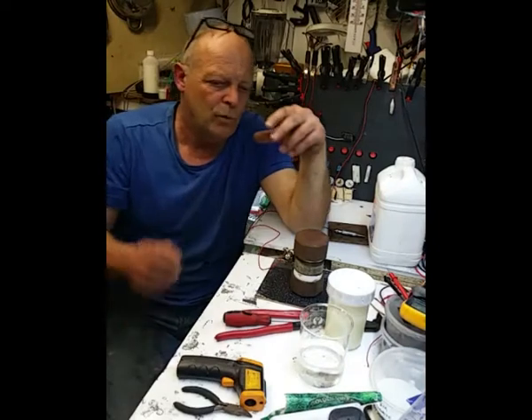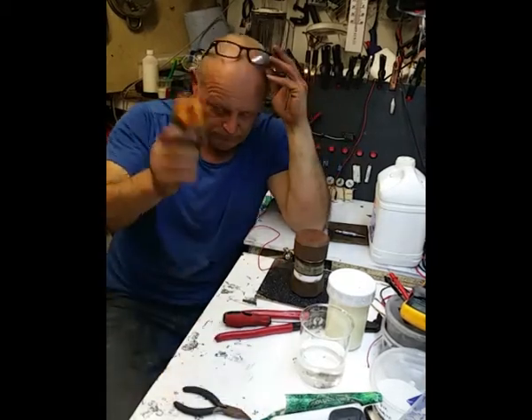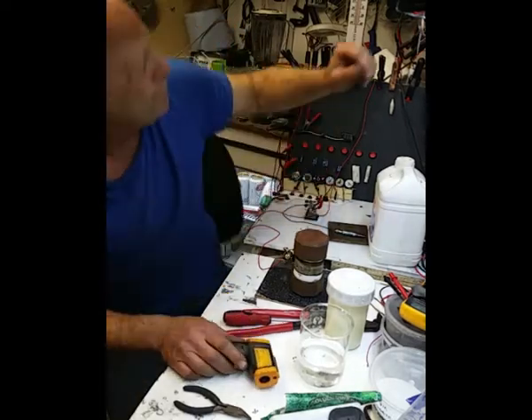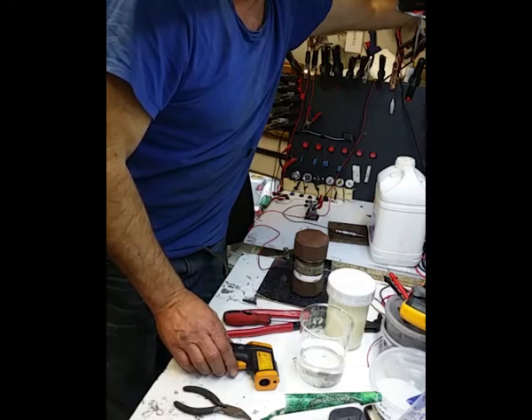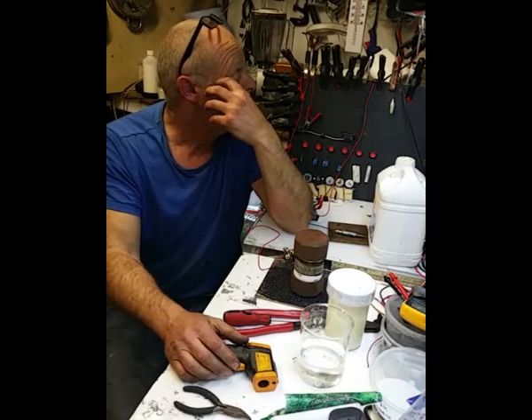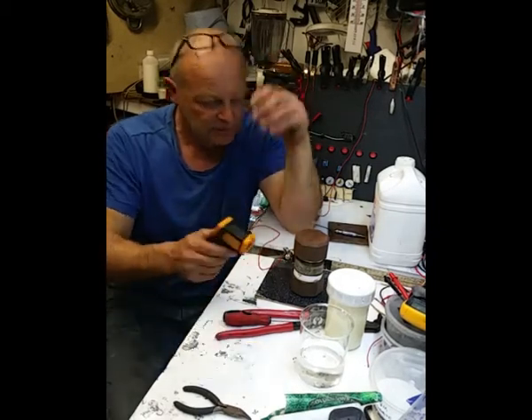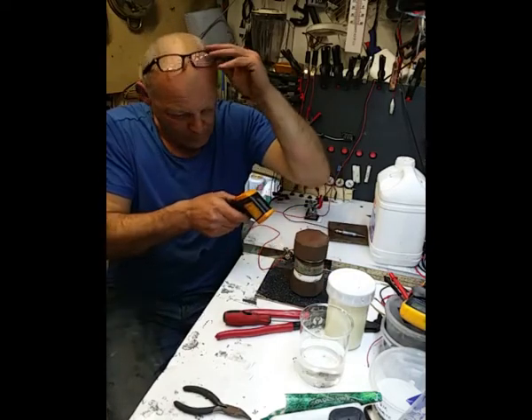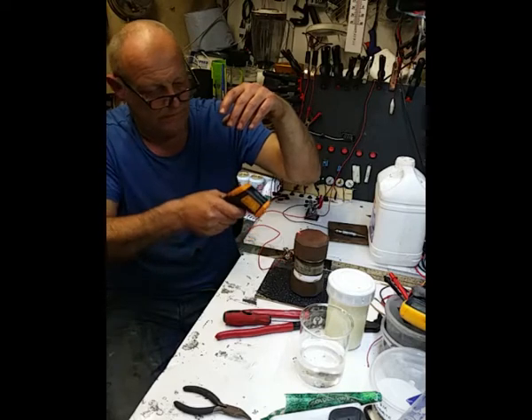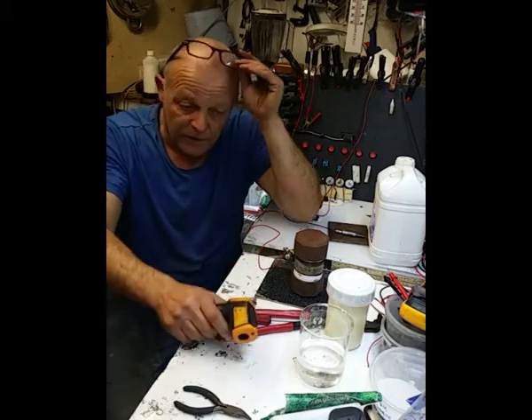So what I've done with my separator in this new battery, I thought to myself, okay, while we're on, I've just turned that up to 8 volts, well 7.9 actually, and it's drawing 7 amps. So while I'm yapping, we'll see if the temperature goes up. I can't imagine it would be right now, but no, I can't see any increase at the moment.